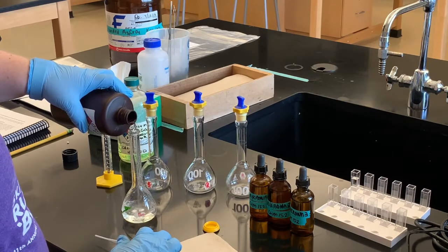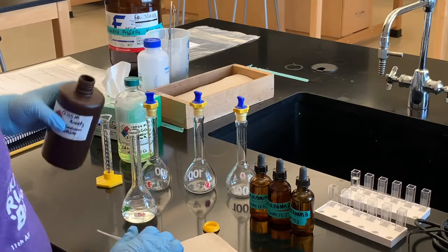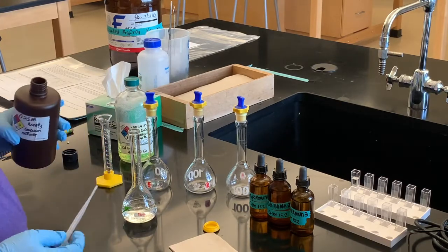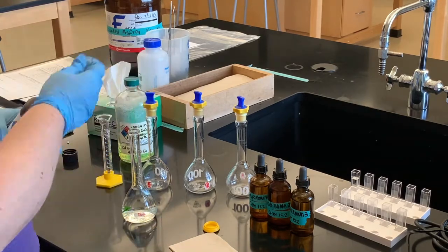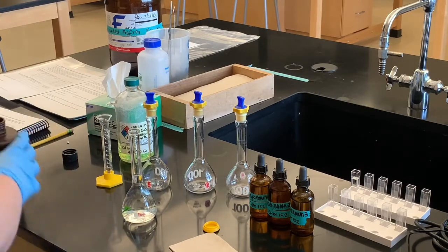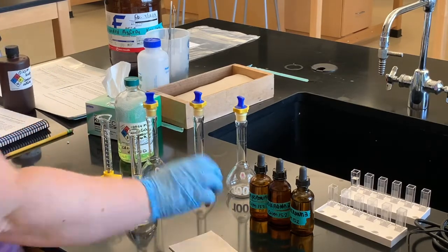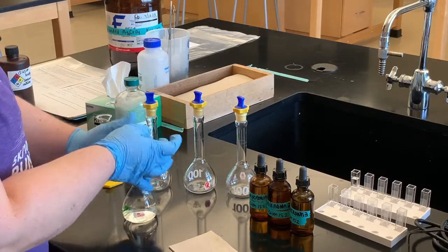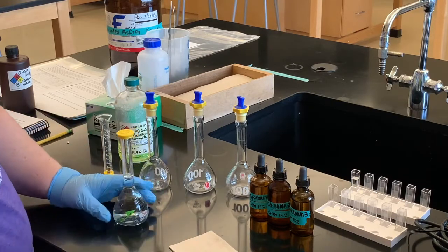Be careful when you get close to that line, because you don't want to go over it — that would add too much volume and your dilution won't have the right concentration. Once filled up to that line, put the cap on and shake it up to make sure the solution is mixed well. Then for the other solutions, we're going to do the exact same process.